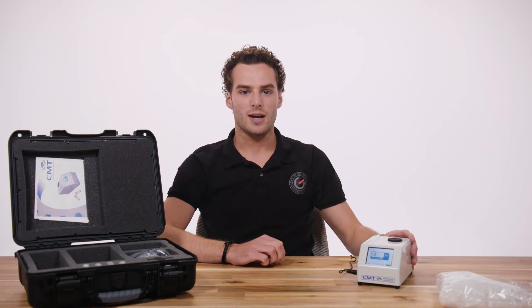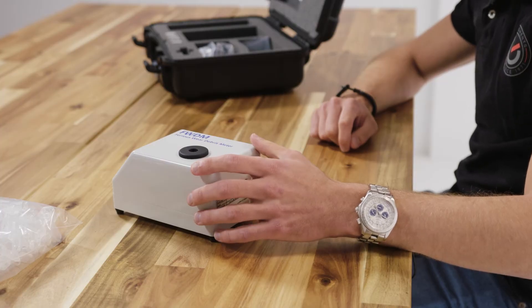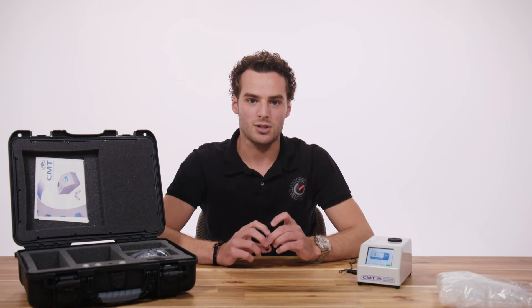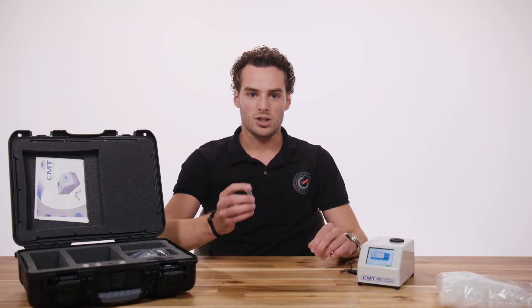Make sure that the device is placed at least 30 centimeters from other electronic devices or heavy metal objects, because this could possibly disrupt proper functioning. The outside of the tube should be wiped clean of any oil debris if necessary, and also make sure that no oil is dripping into the device.